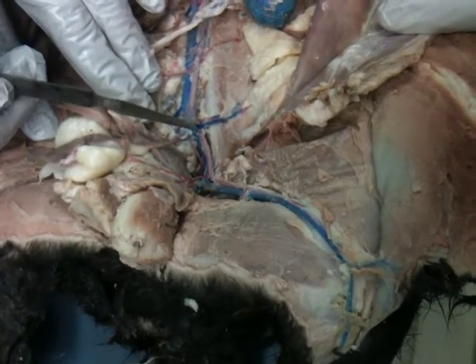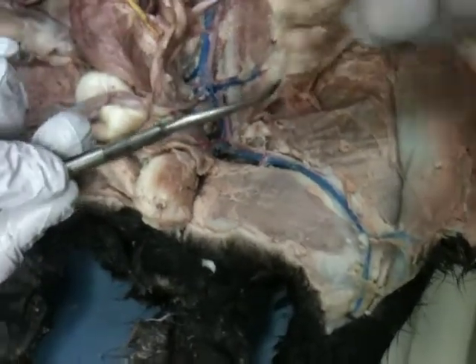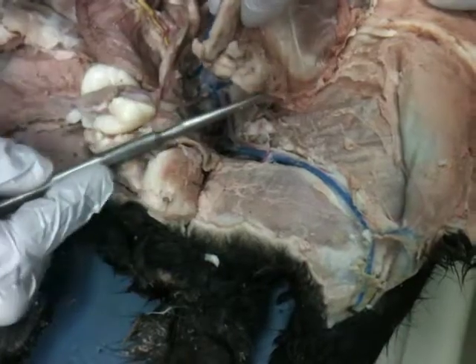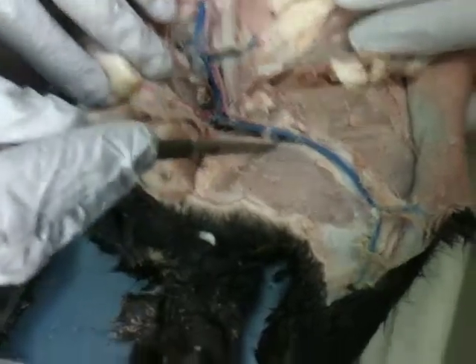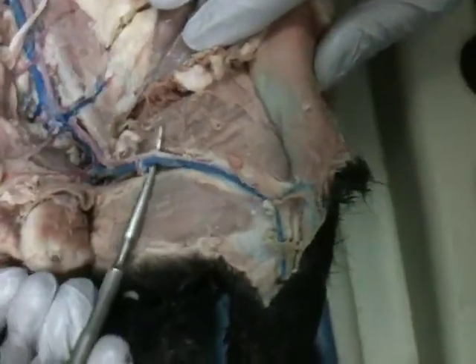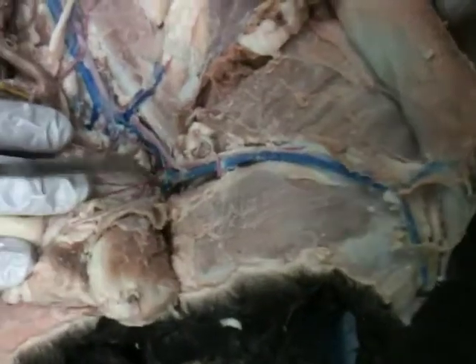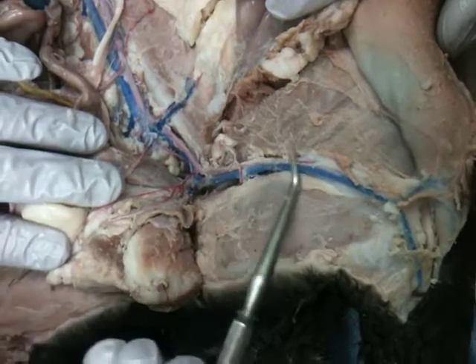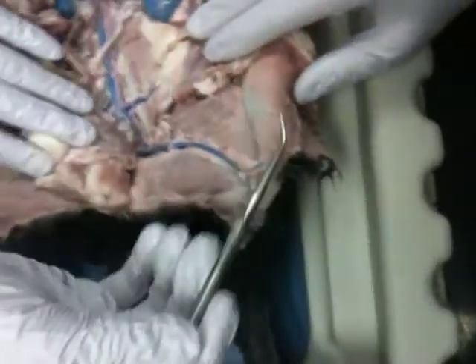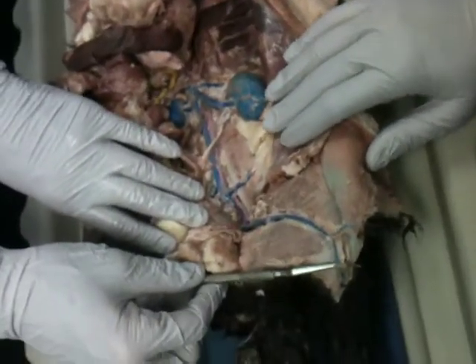The external iliac artery continues on down here. Once it crosses this abdominal wall, and there's an actual wall there, once it crosses that, it's the femoral artery and vein. So anything in this area, femoral artery and vein. Around this area, it sends some other vessels deep. We're going to call those the deep femoral artery and vein down there. This will continue on. You don't need to know some of those other ones that go off, but as far as the vein, this is the great saphenous vein.